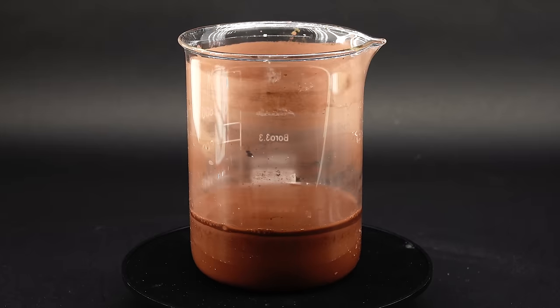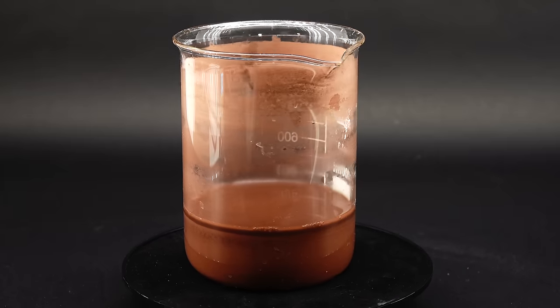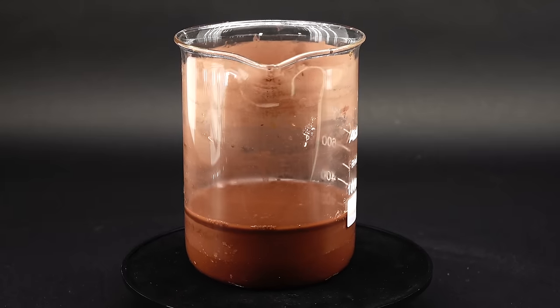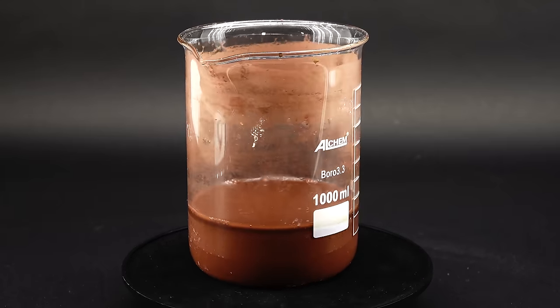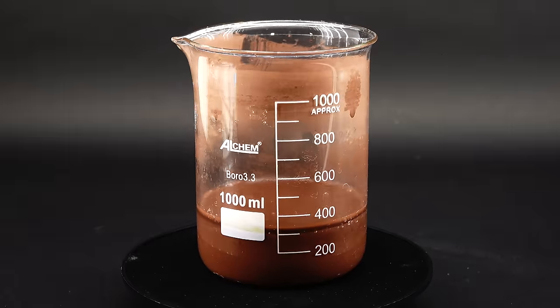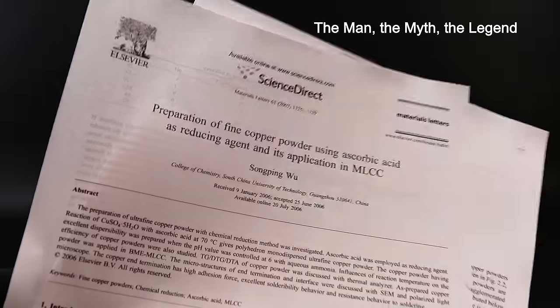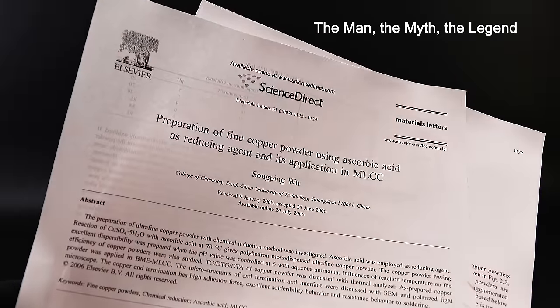For obvious reasons, I can't measure exactly how much of the powder I managed to make, but since the yield is probably similar to the first batch, I managed to make a total of around 490 grams of some ultrafine copper powder. It's really cool that my dear Song Ping Wu didn't betray me, and his procedure worked really well, so he deserves a shoutout.